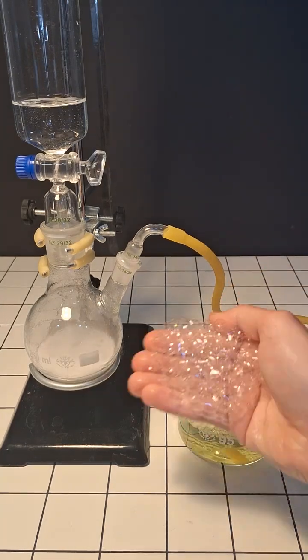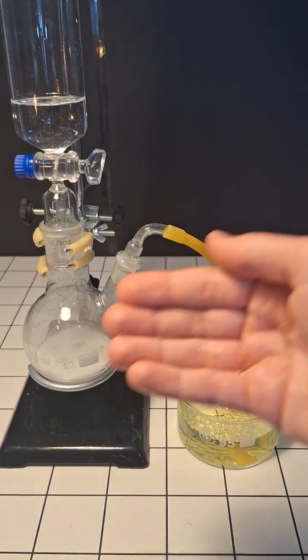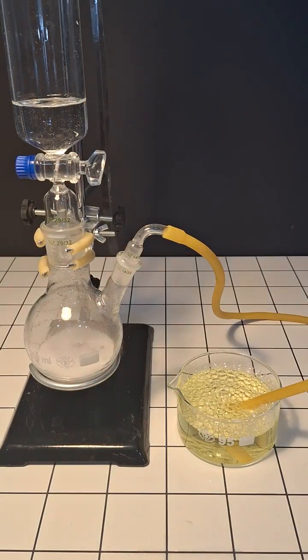After collecting some of them I'm gonna try lighting them on fire. The reaction was still going so I decided to do it a few more times.